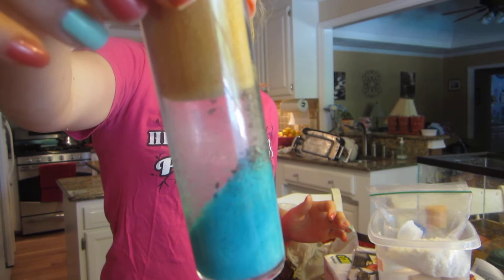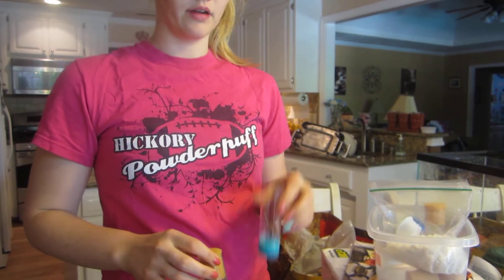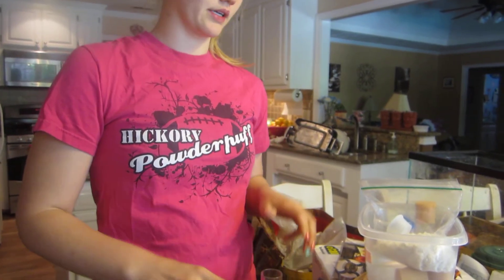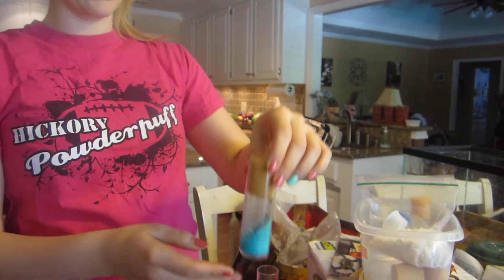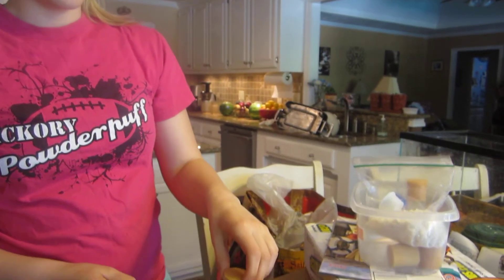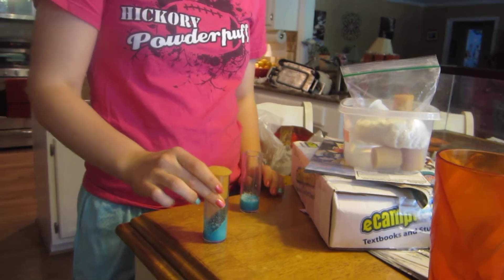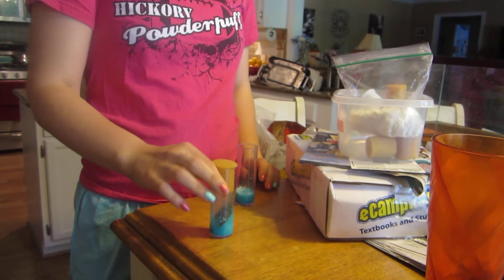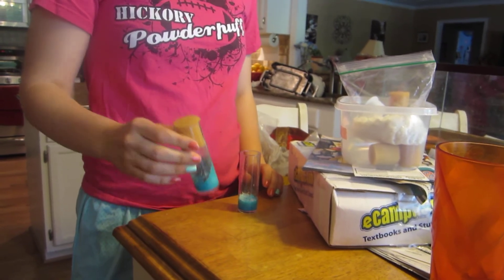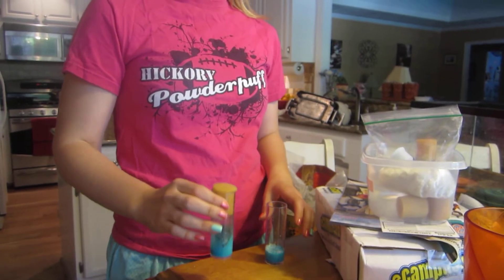I need to get the fruit flies that are currently in this vial to this new vial. Everyone's wondering: they're going to fly away, how do you do it? When you take the vial and tap it on the ground, they will all fall down. So I'm going to continuously tap this.